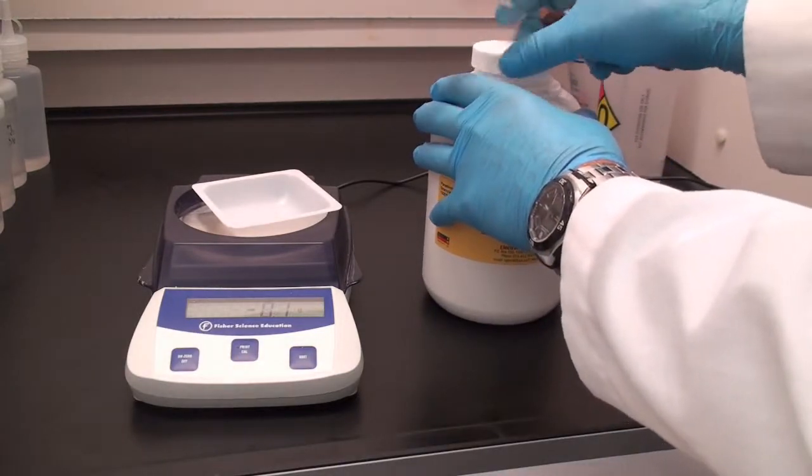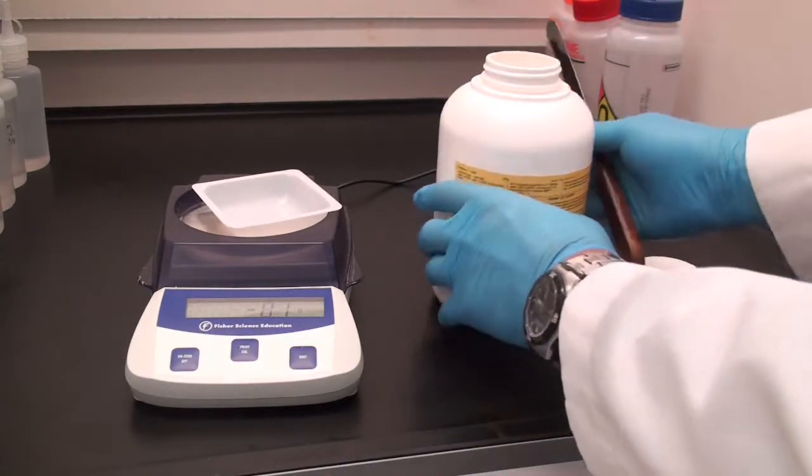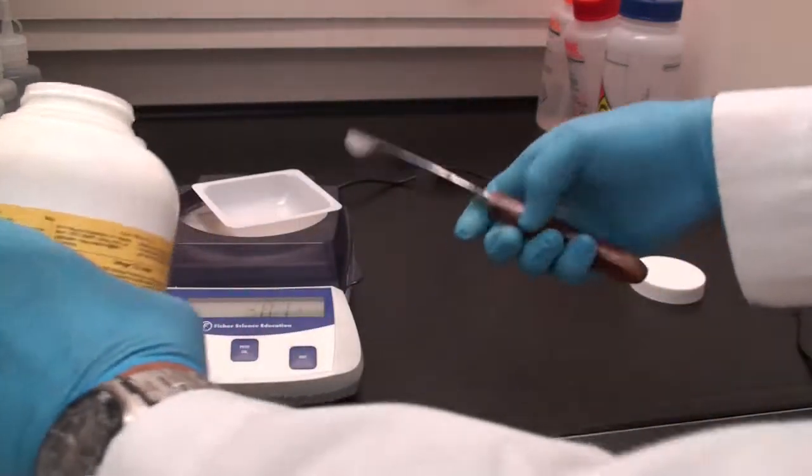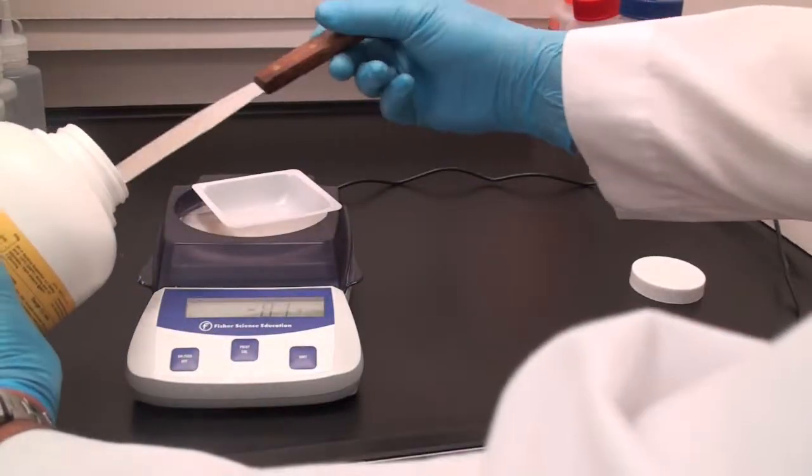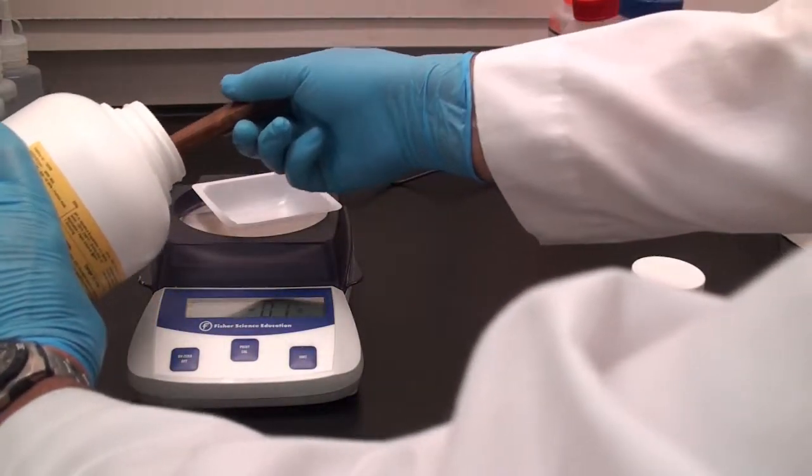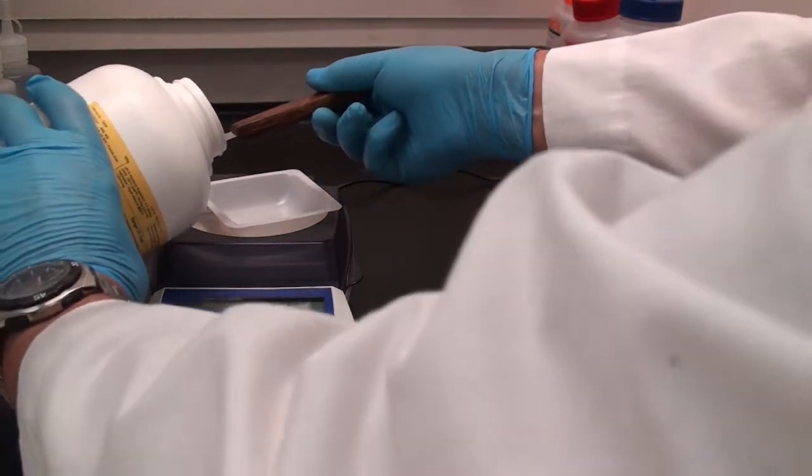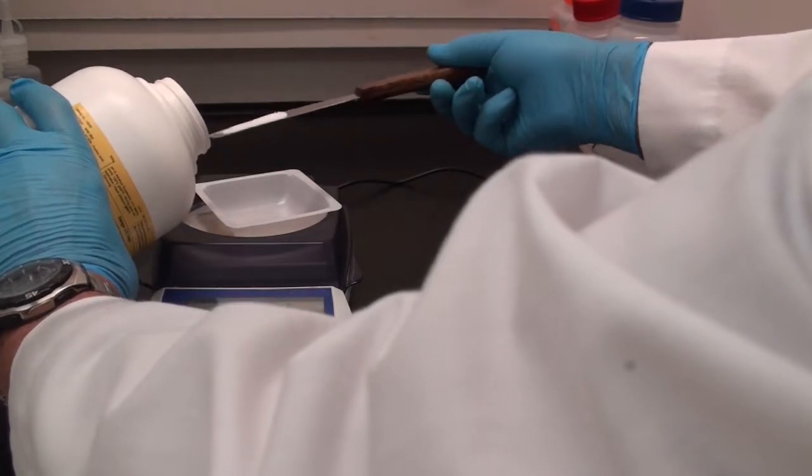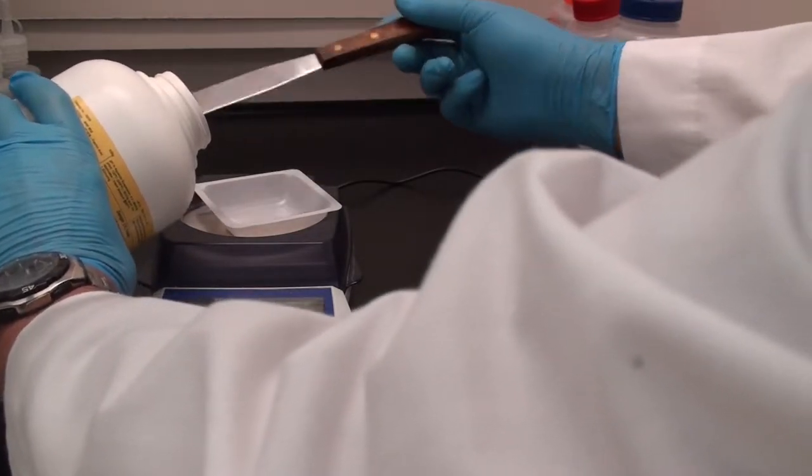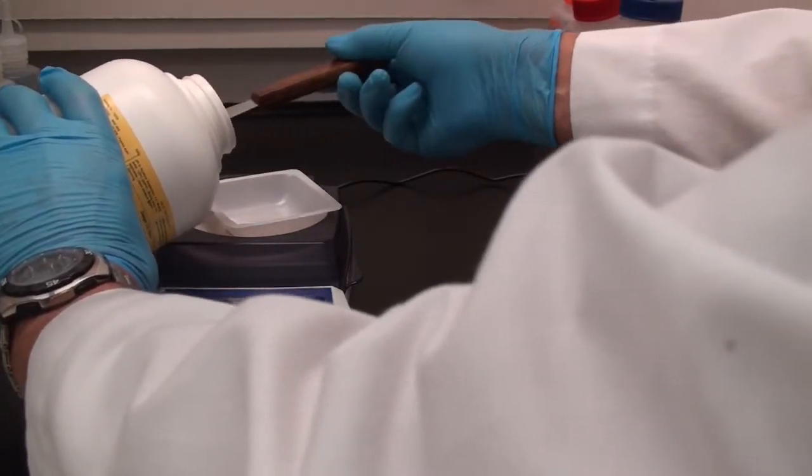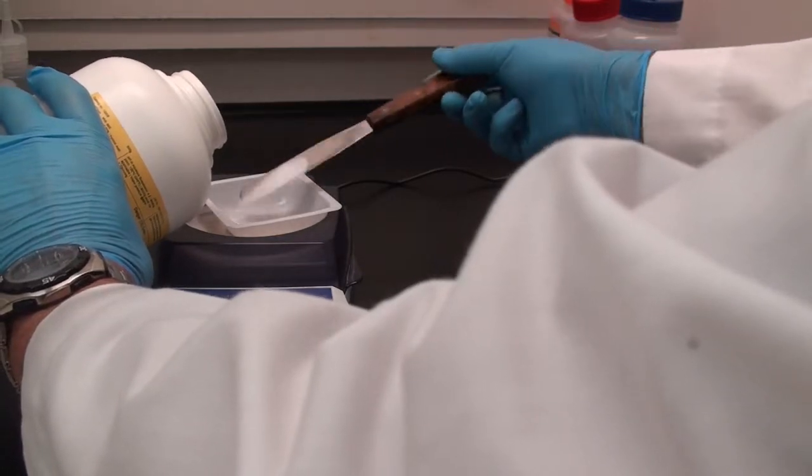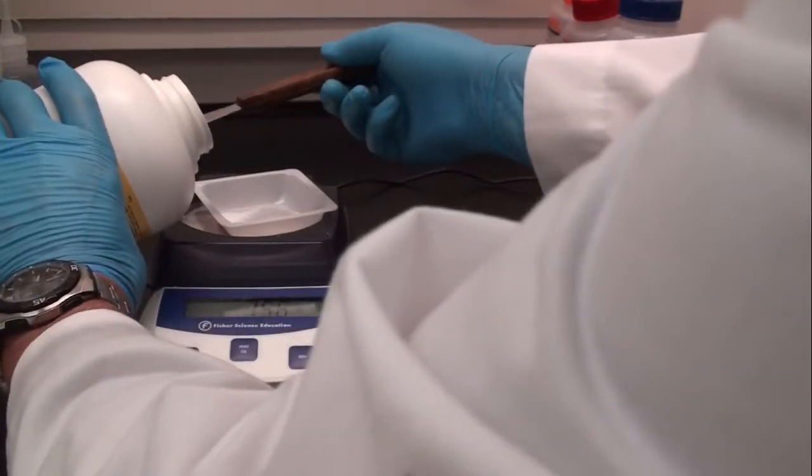Now I don't have the fume hood on for the simple reason that otherwise the air coming into the fume hood might disperse your paraformaldehyde. The granular is not as bad as the older powdered form, but still I don't want to have the fume hood on so the paraformaldehyde doesn't fly all over the place.